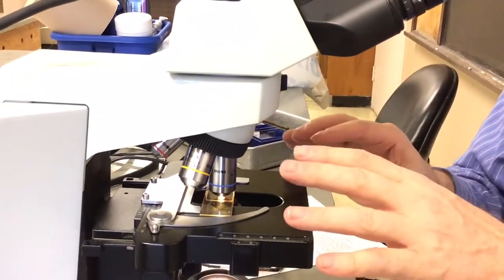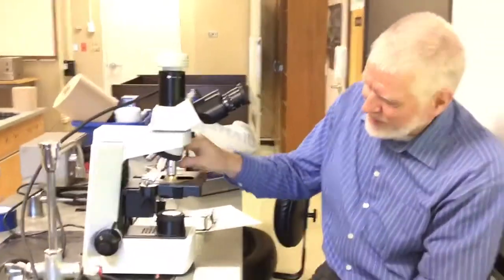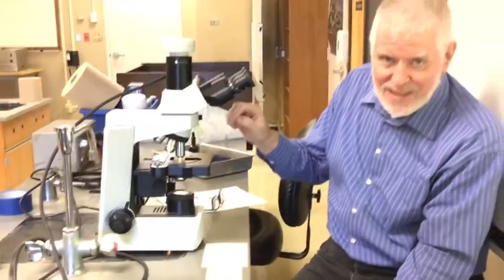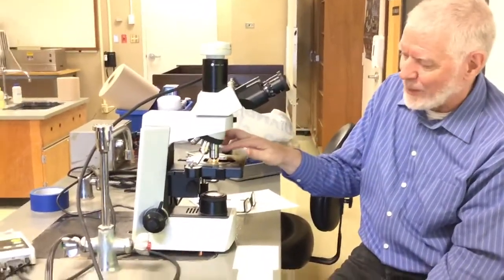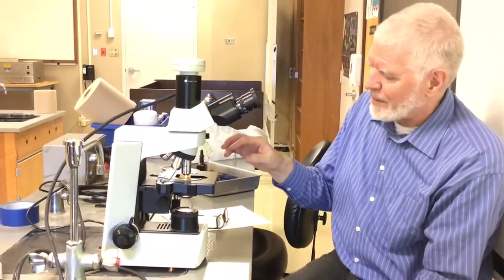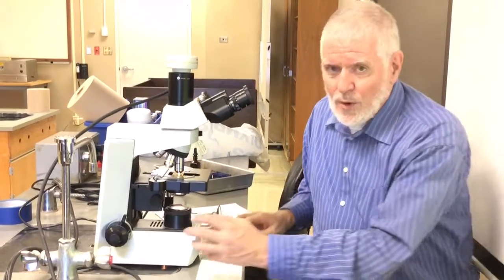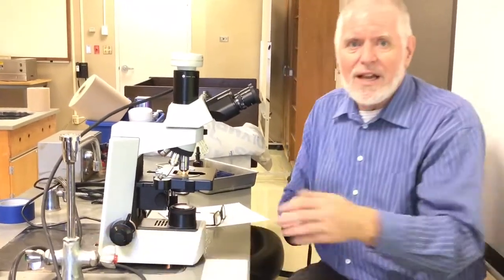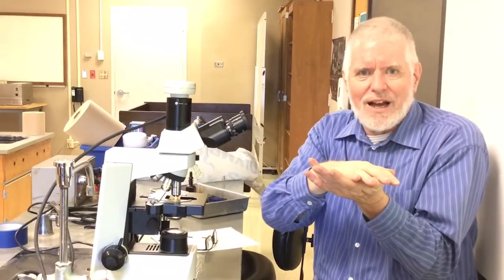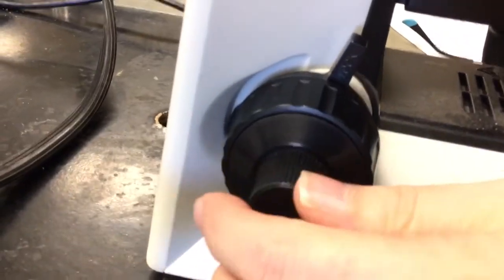But when you move your high power lens into position, you don't keep looking through the scope. You lean away and watch to see if it's going to hit anything. Because some preps are pretty thick, and you can actually smush your cover slip with the housing here and break the cover slip. Theoretically, you could break the lens, but that pretty much never happens. So you watch that. Also, because it is so very, very close, you no longer turn this big old crank to focus, because it's too easy to drive the lens into the cover slip in the slide and break it. So you use the fine adjustment. The fine adjustment, this knob in the middle, it moves this, but you can't see that it moves this.